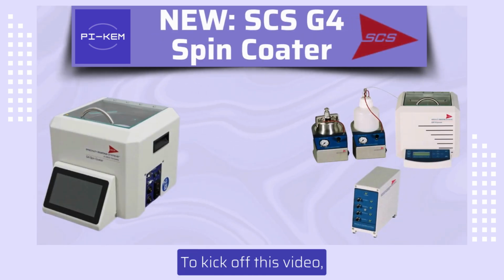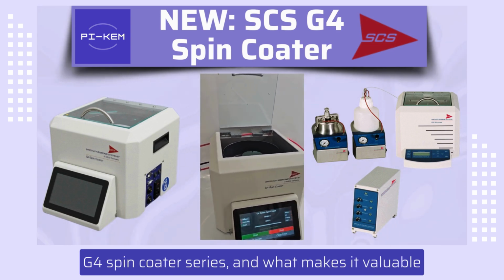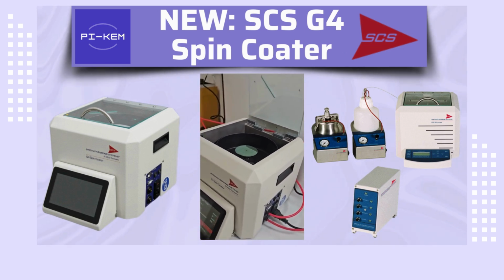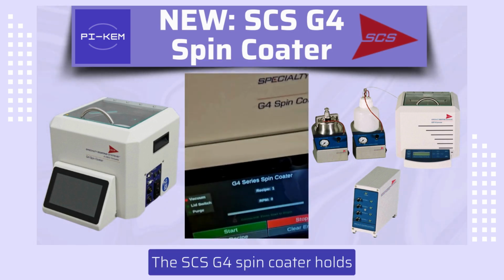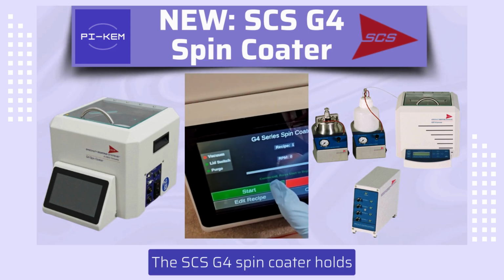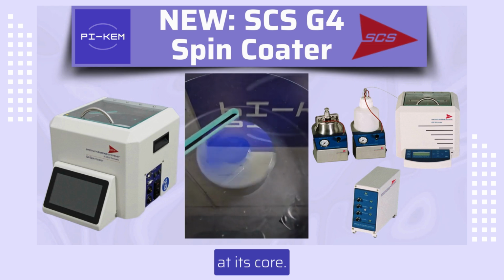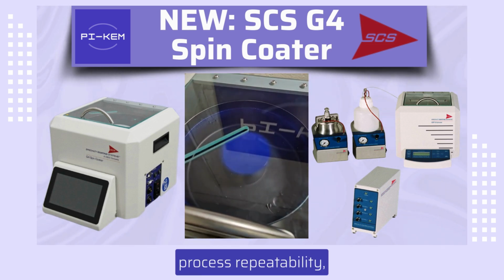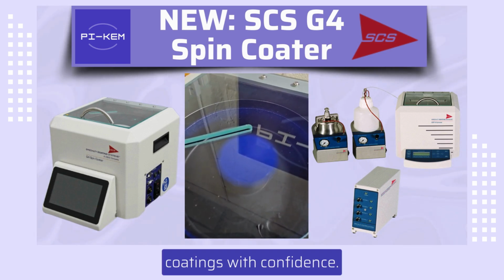To kick off this video, let's talk through some of the unique features of the SCS G4 Spin Coater series and what makes it valuable in both research and development environments. The SCS G4 Spin Coater holds operating precision and programming flexibility at its core. Engineered with high levels of rotational accuracy and process repeatability, this spin coater allows you to deliver high-quality coatings with confidence.